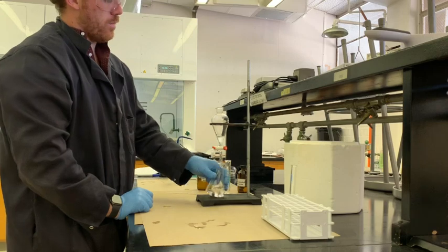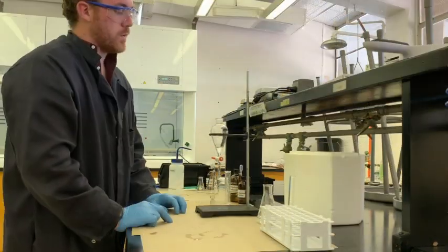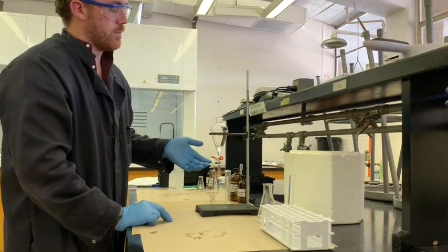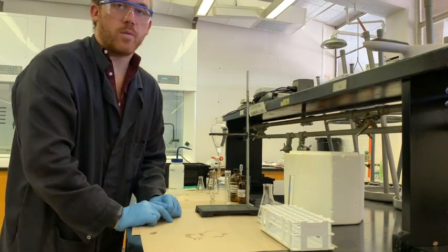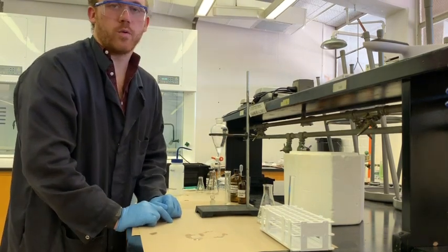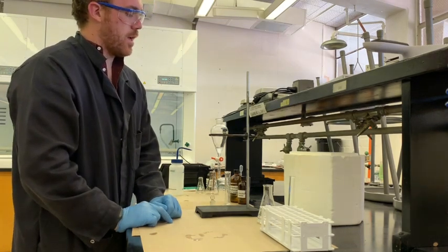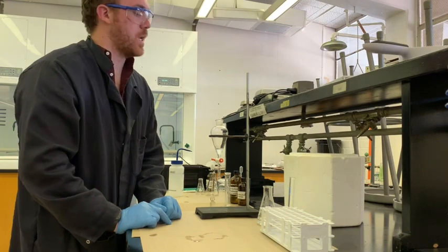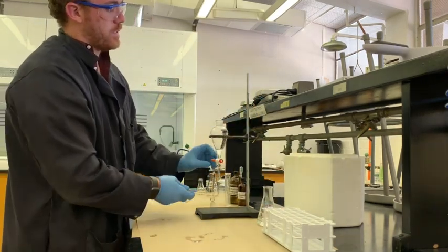This right here is our product. So distillation is a little bit time consuming. And when it comes to actually analyzing this product, there's actually a pretty easy way to do that without having to go through the whole distillation process, which is valuable and definitely something that's worth practicing, but not what we're going to do today. For now, we're just going to take a little bit of this product.